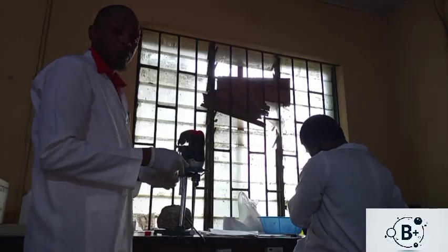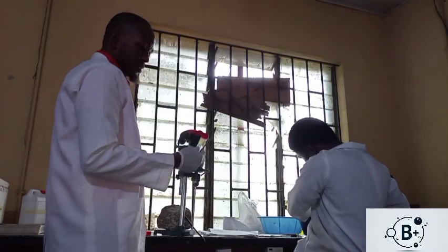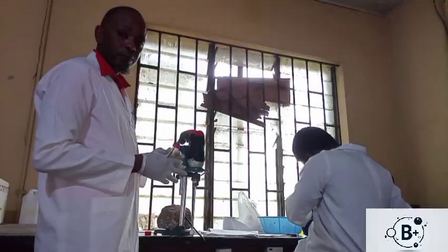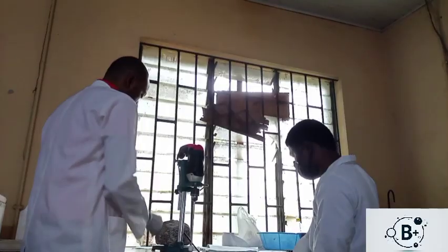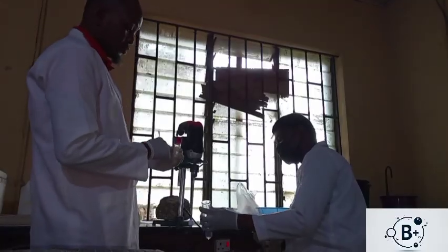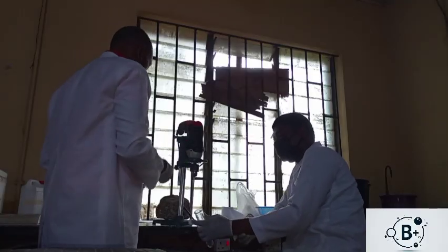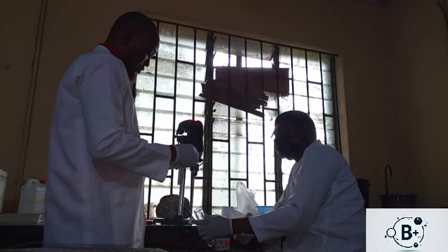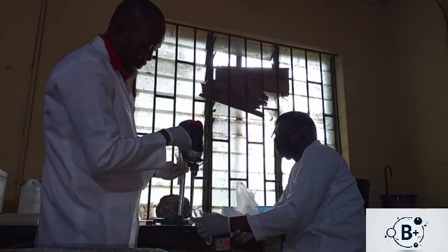So like I was saying about the code, this one is 6ROET. So the 6 here symbolizes the group, because we group all the animal models into groups. RO is the code for the animal, the mice, the animal model that is being used. Whereas the T symbolizes the code for the particular tissue.